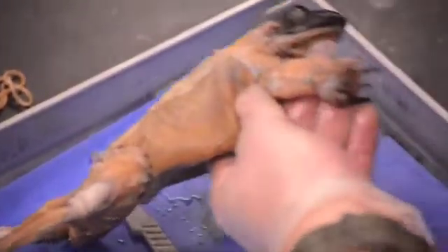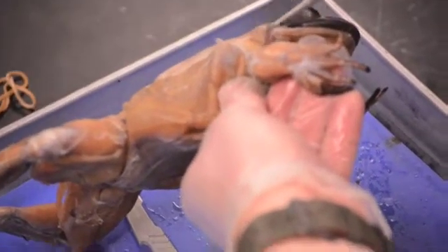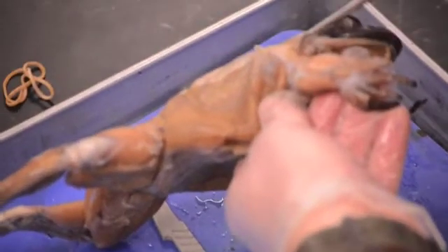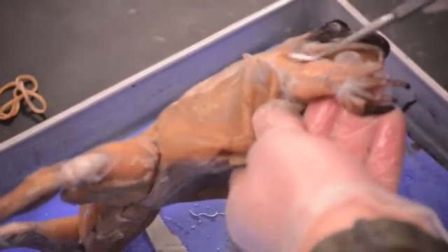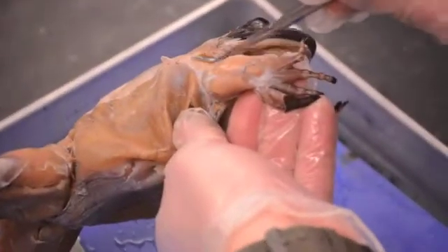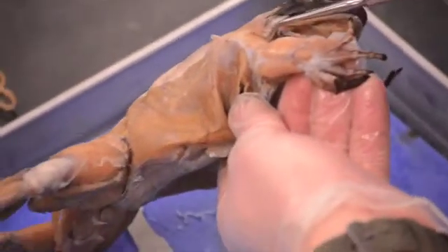Where the latissimus dorsi meets the arms, this structure is the anconius — the shoulder area muscle. I think of it as the frog's armpit muscle: the anconius.